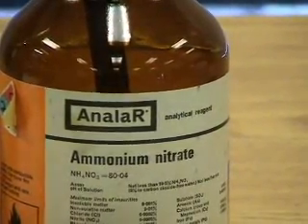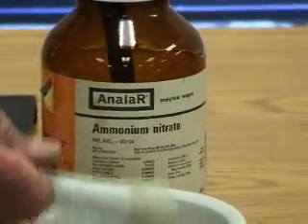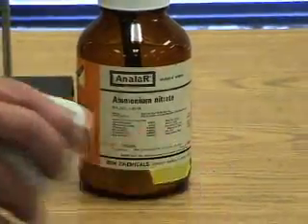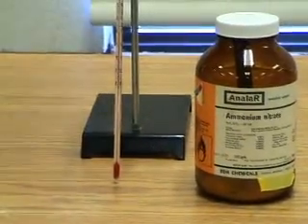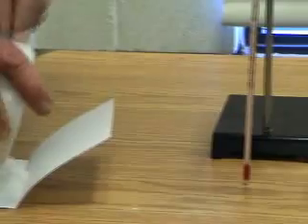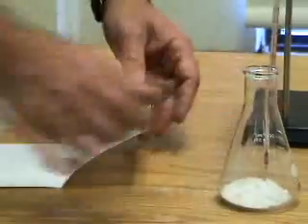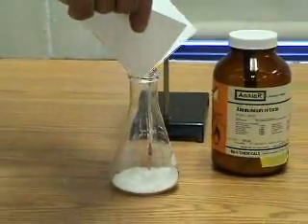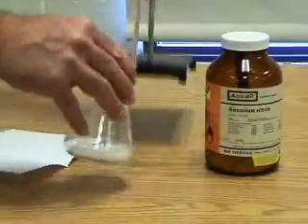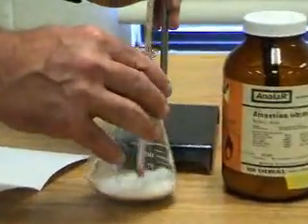You're looking at the samples of barium hydroxide and ammonium nitrate. We're going to put the ammonium nitrate into that barium hydroxide. Ground that up to increase the surface area. Then pay very close attention to the thermometer. These powders are both at room temperature to begin with.